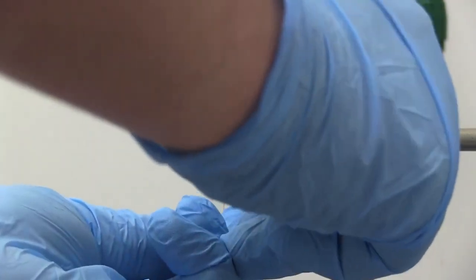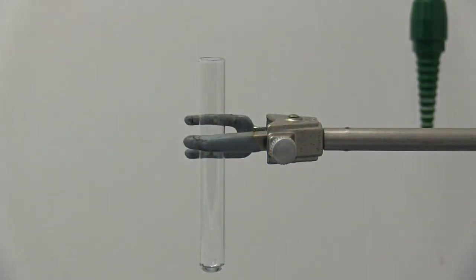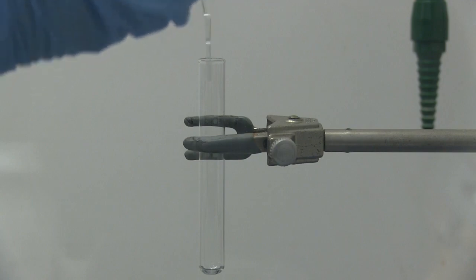I'm also going to go ahead and get our Buchner funnel set up to filter it. This time I used a little bit more ethanol and it seemed to have dissolved everything, so now I will let that sit and recrystallize.